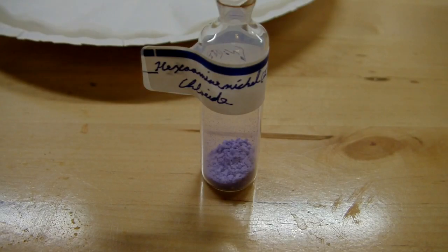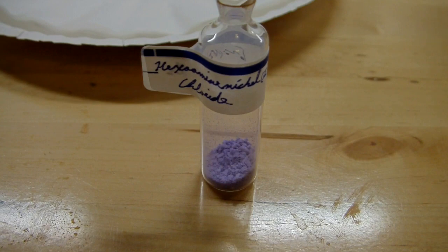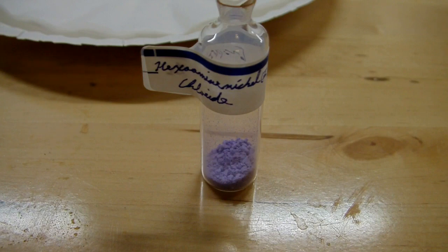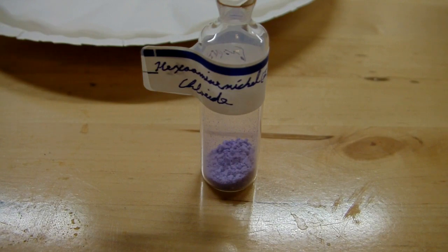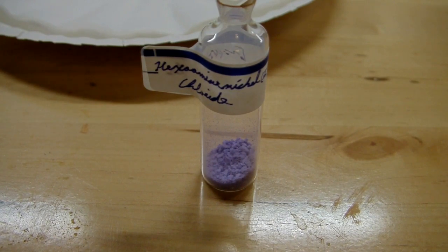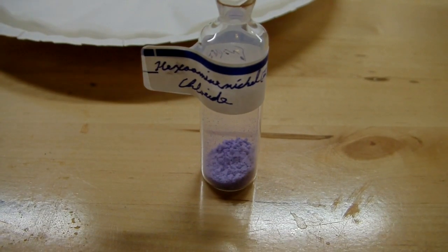Here's my final product of solid hexaaminenickel chloride. I ended up with about 0.6 grams of it from the total of 3 milliliters of the nickel chloride solution that I used. So I've got quite a bit of solution left but it's going to take me a while to process the rest of it. I'll probably end up having to distill some more acetone to finish it just because I had to use so much for this one. Once I finish off the rest of this I'll let you know how much I got and what my yield was.